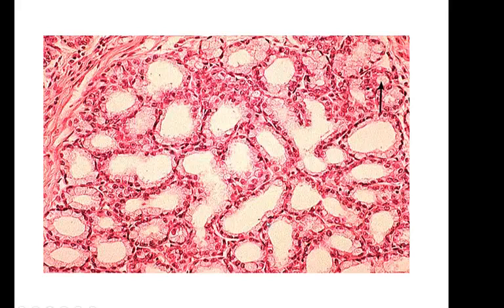So you might think, well, this is 2 cell layers thick. It's not really. Each of them has their own basement membrane and opens to the surface. And so all of these are examples of simple cuboidal epithelium. They're little tubes that have been cut in cross-section.